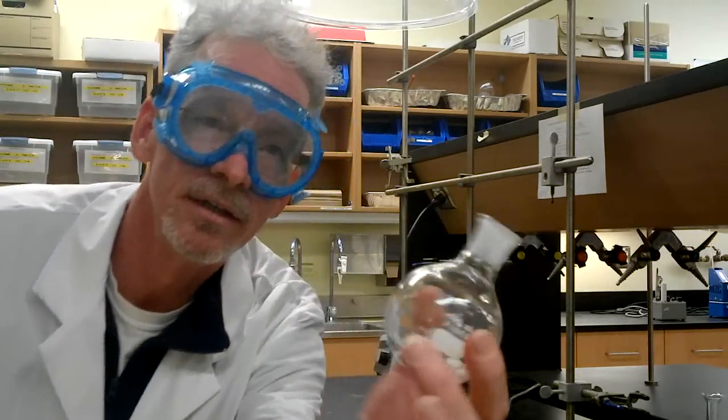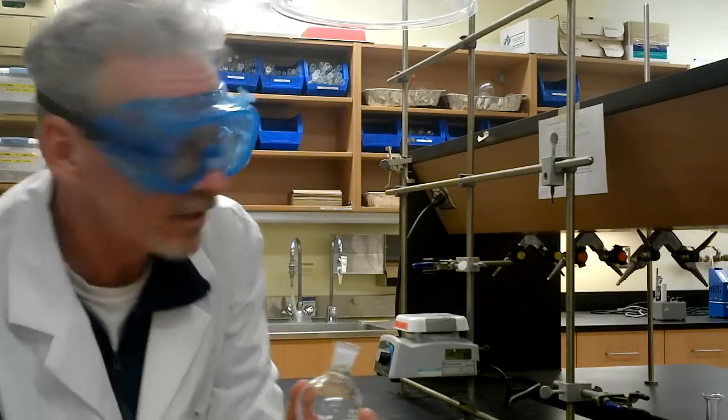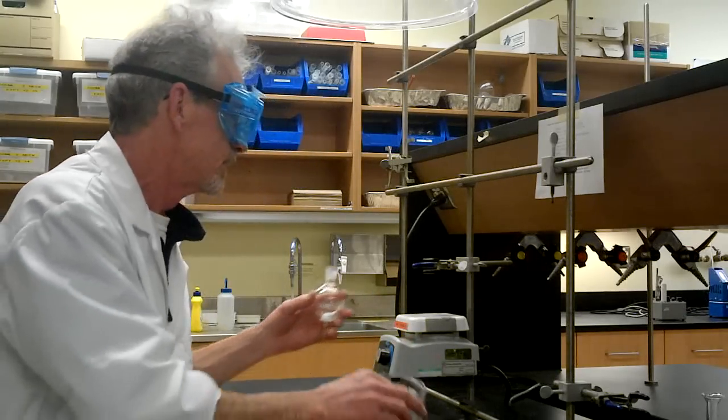So here you see a clear, colorless liquid of methylbenzoate. It has a nice, fruity smell, which is very common for an ester.